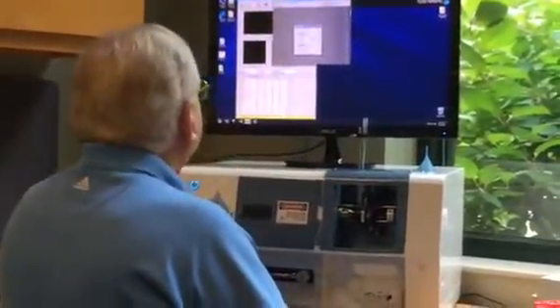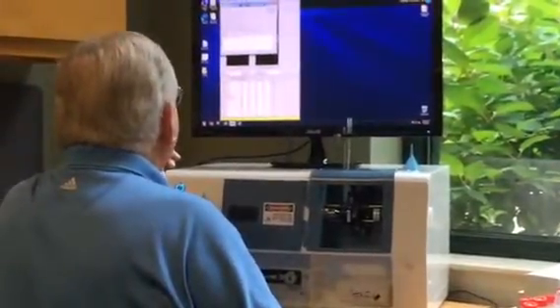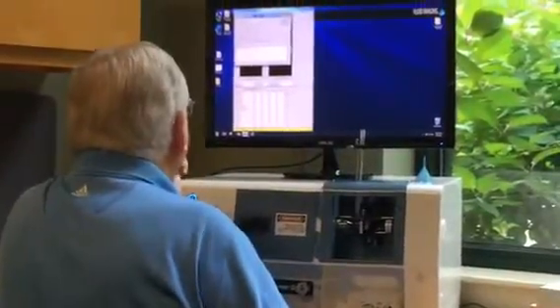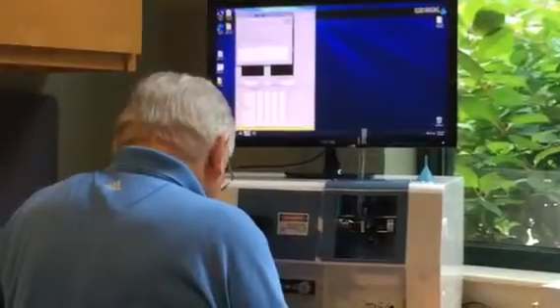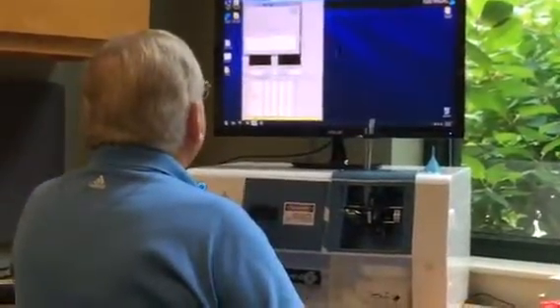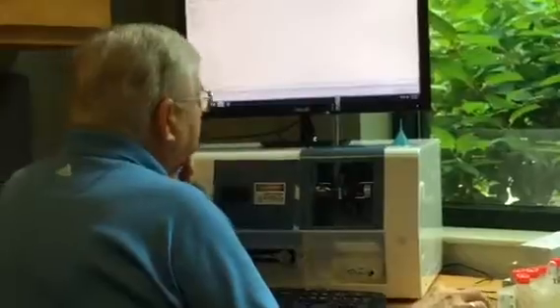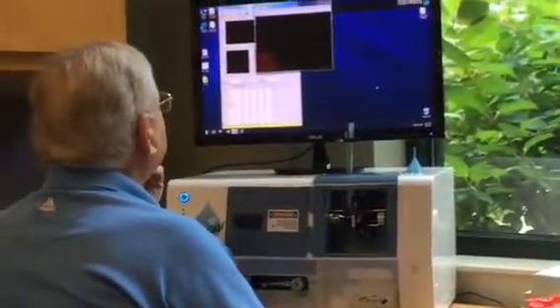Okay, so great, it's in, there it is. There it is, stop. And now we go to auto image right away. We already have all that done. Oh, it didn't save it. That's the run number 2 note. Oh yeah, where is it? Interesting. Here, right. 50, dilute, real quick. Alright, done, okay. This one, we can do the transfer, there it is, and go. Oh, how's that for fast? All right.